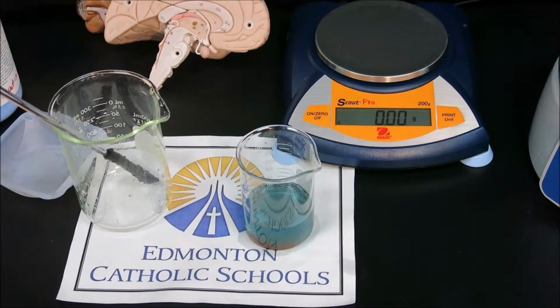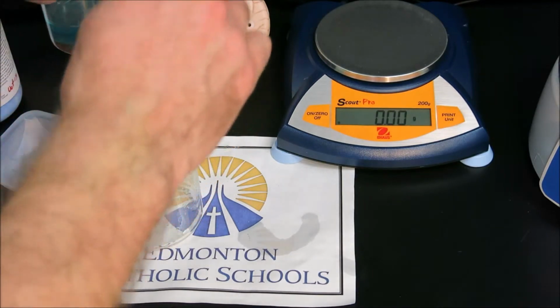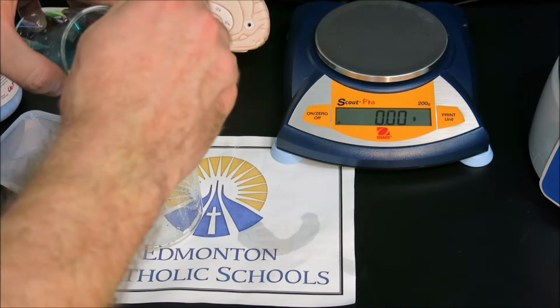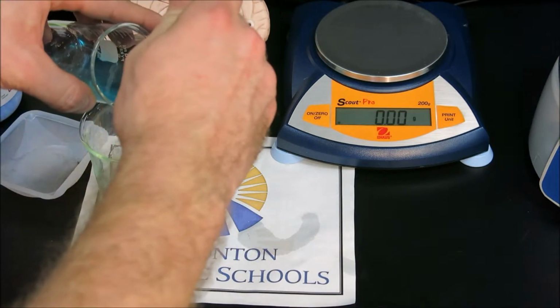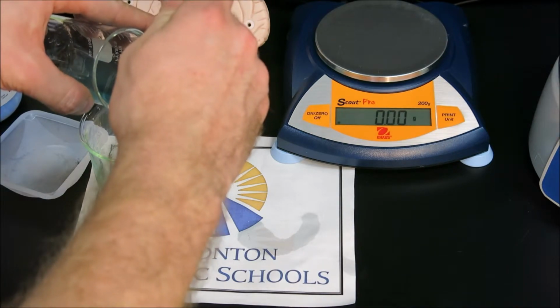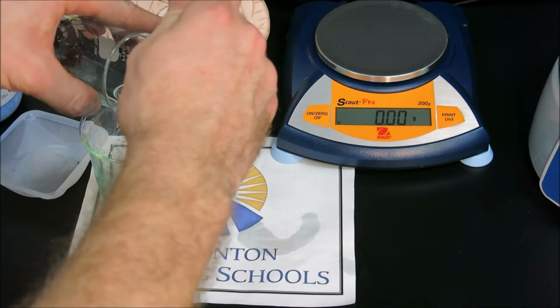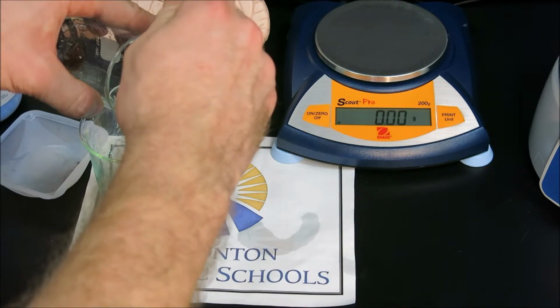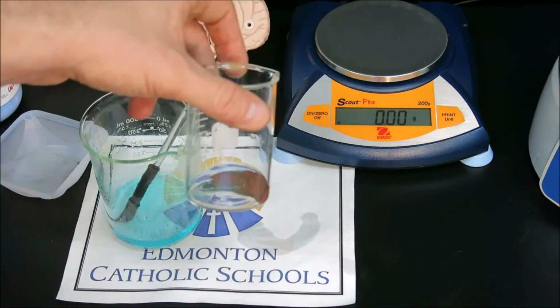We're now ready for the second stage of decanting. So again, we will carefully lift this and pour just the solution layer off the top. We use the stir rod here with the properties of water and adhesion so that instead of splashing, we can pour gently into the stir rod and therefore not lose any particles by pouring out very quickly, and also to not make a mess splashing. And we can see the copper is becoming more purified as we go.